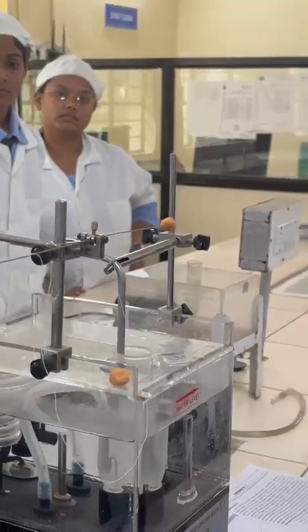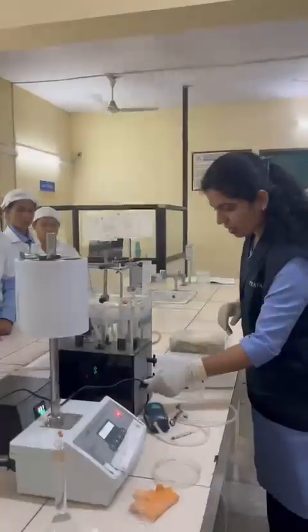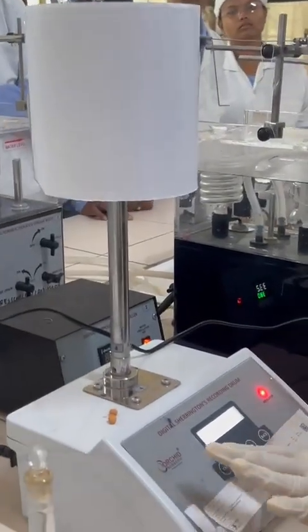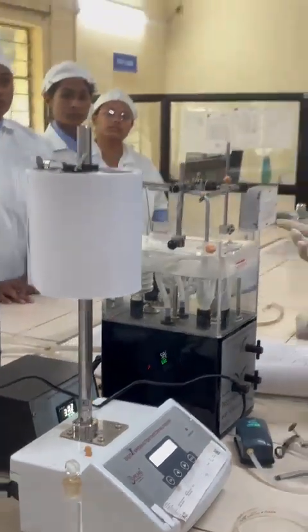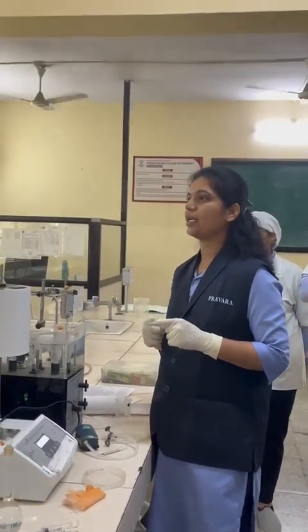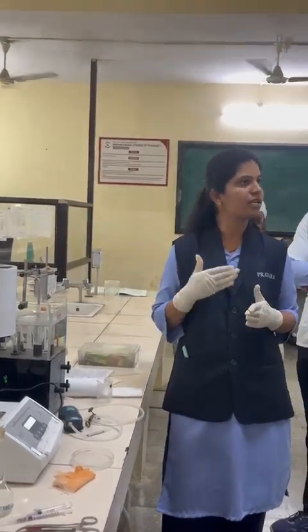So this is the second washing. Again we have to drain it. You can see the tube is draining. Likewise we have to give 3 washings at each step. Again we have to start the baseline. Here you can see the baseline is now for the second dose. Again we have to give the injection after starting the contact time, and likewise gradually we have to increase the dose and take the response of each dose.